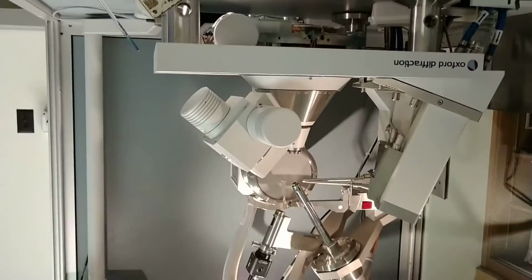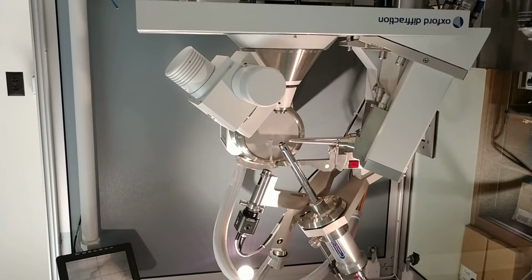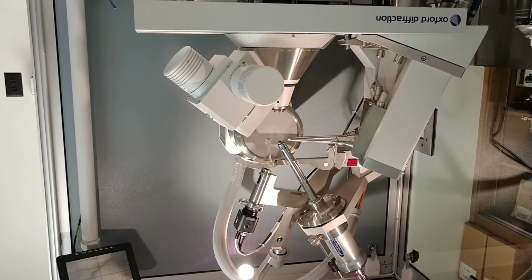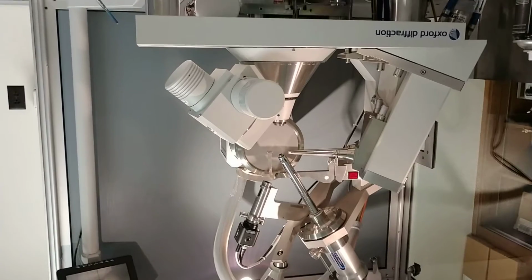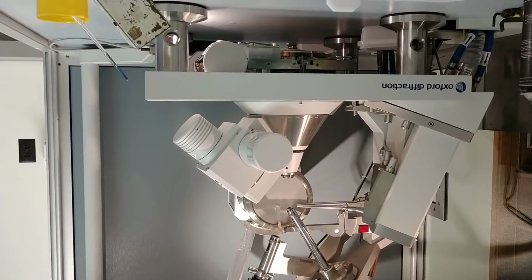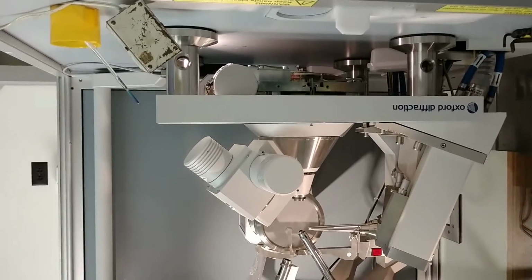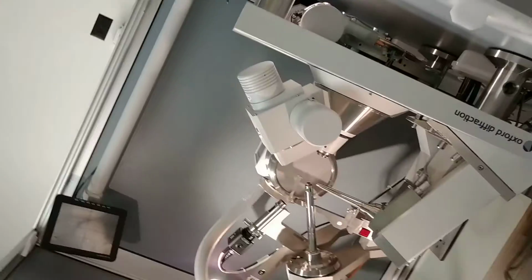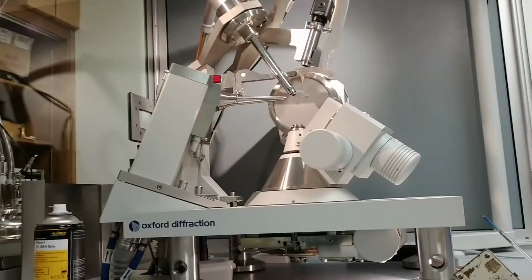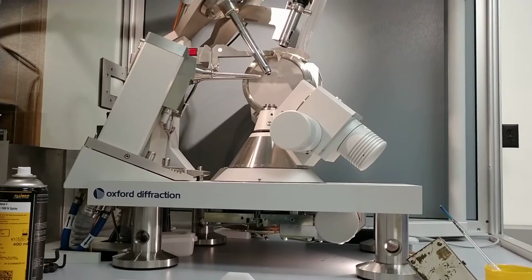It looks like I can safely go to minus 80. Do we want to go there? No, we're going to minus 175. Minus 175, okay. And that's why I asked. It might be minus 170, I'll do 170 just to be safe. It's close. It's going to be close.